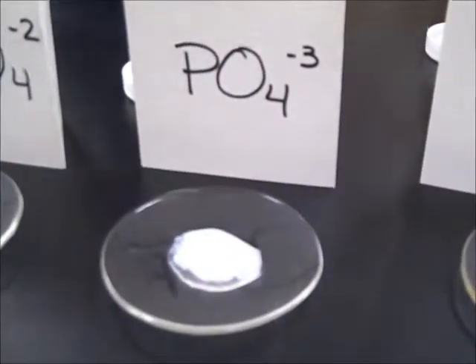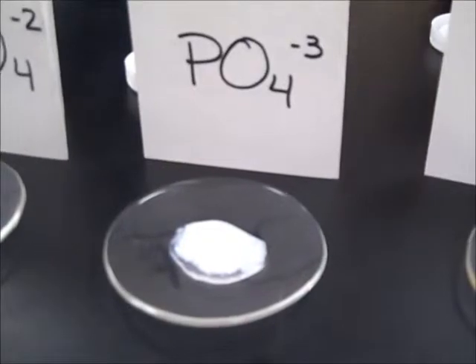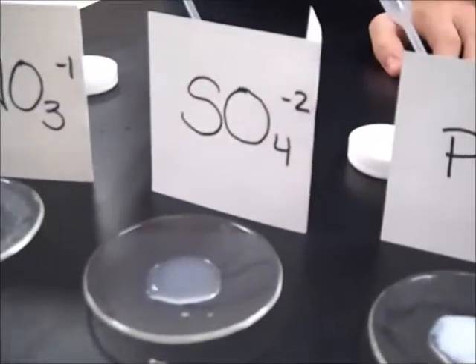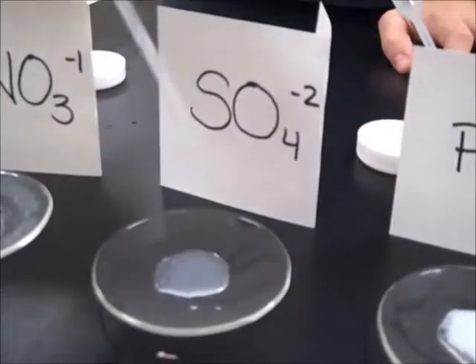Yeah. Nice. Not quite as white, but nice. Very good. That was the lead and the phosphate ion, PO4. Okay. This is the sulfur. Sulfate, that's right, SO4.